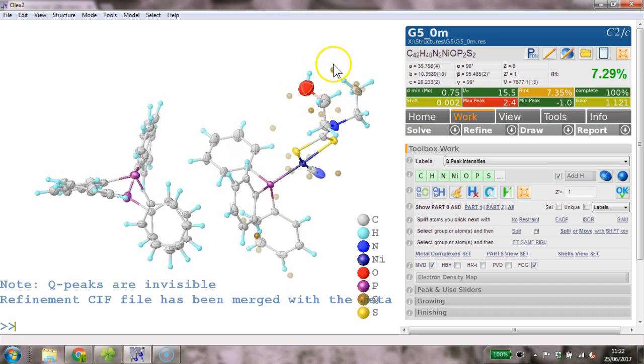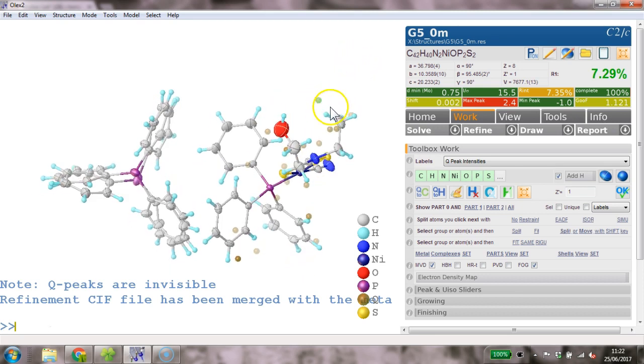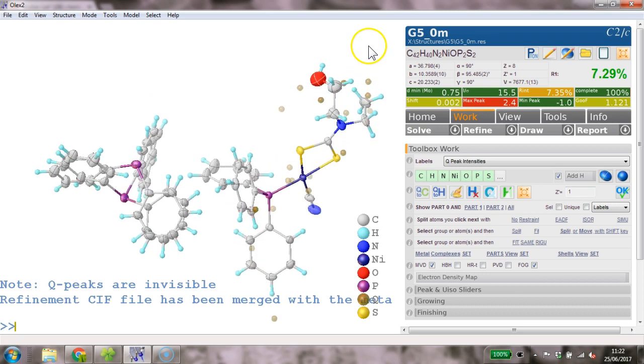It's tempting to call this maybe another occurrence of this oxygen, 1.75, but I think the distances then will not work out. So if I put this on, it's 1.7. It's just too far away. Yeah, I would leave it at that.